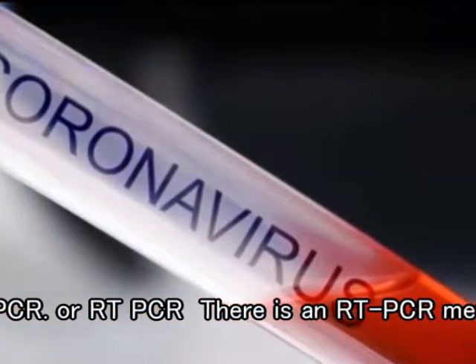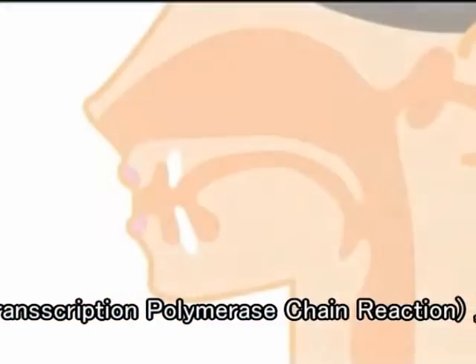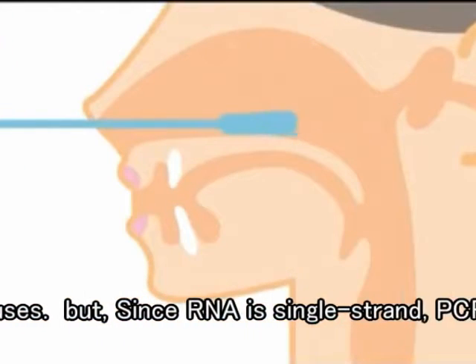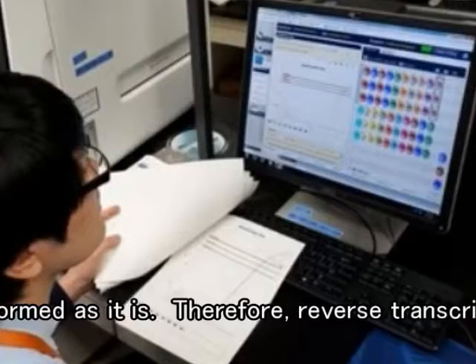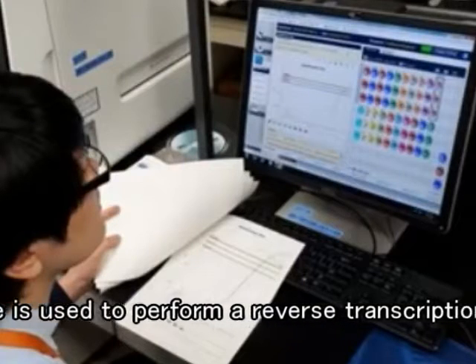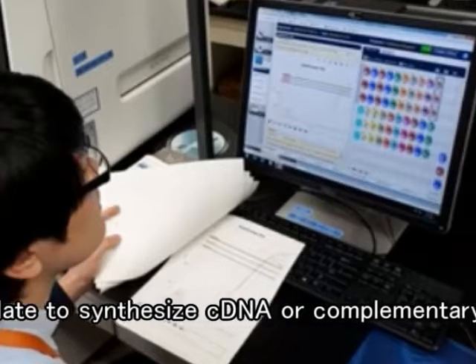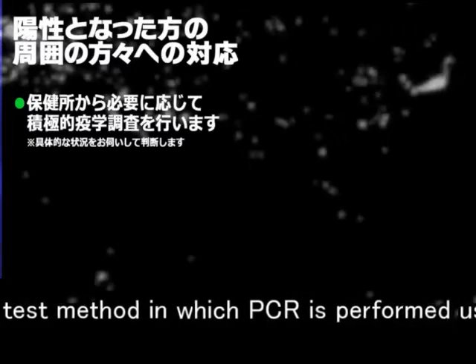It is named as reverse transcriptase PCR, or RT-PCR — reverse transcription polymerase chain reaction — a PCR method for RNA viruses. Since RNA is single-stranded, PCR cannot be performed as it is. Therefore, reverse transcriptase is used to perform a reverse transcription reaction, using RNA as a template to synthesize DNA, or complementary DNA. PCR is then performed using this DNA as a template.